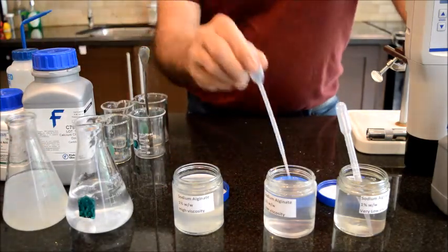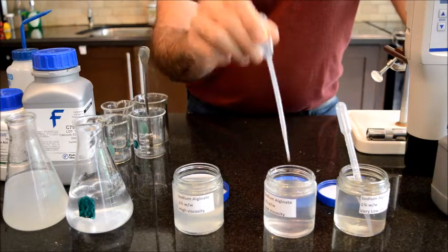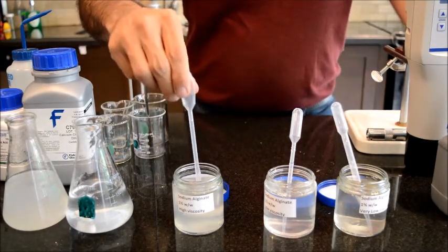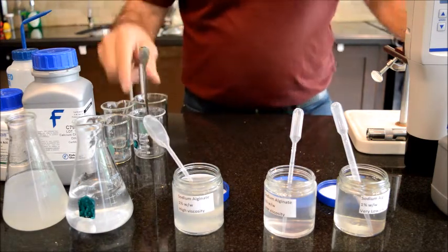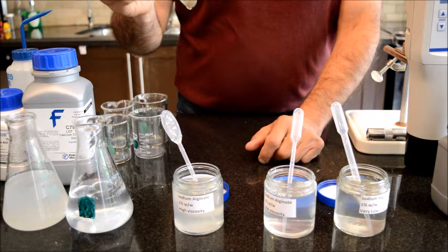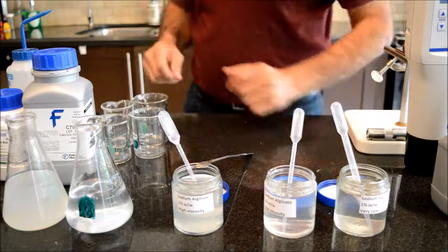On the other hand, the medium grade viscosity, for sure, still looks like a liquid, but it looks like a viscous liquid. It is not like the other one, which looks like water flowing. And then the high viscosity, for sure, it feels like a gel, but it does flow. Maybe I can use the spoon a little bit and show you the viscosity. So it is dripping, and it does indeed look like a gel material. I'm going to just grab a napkin and clean up.